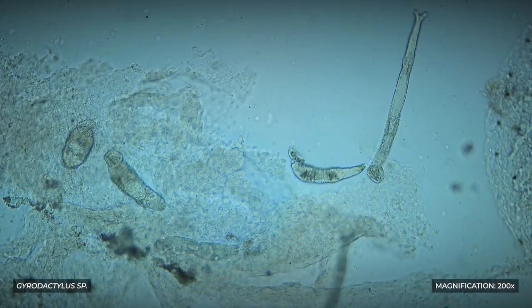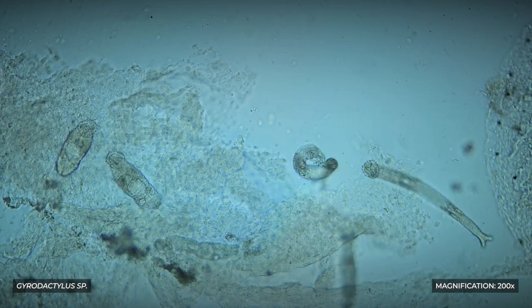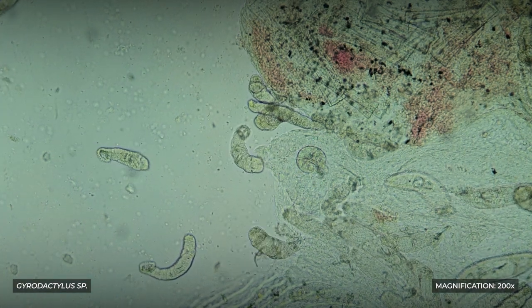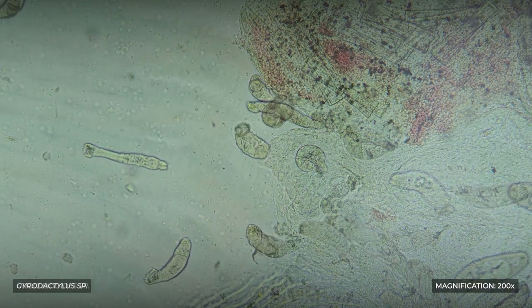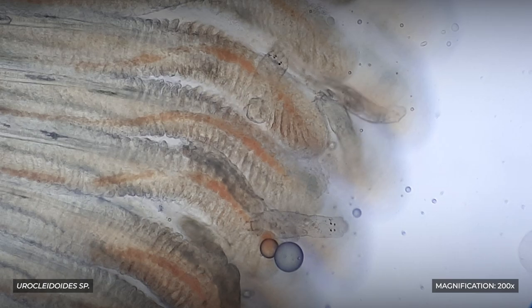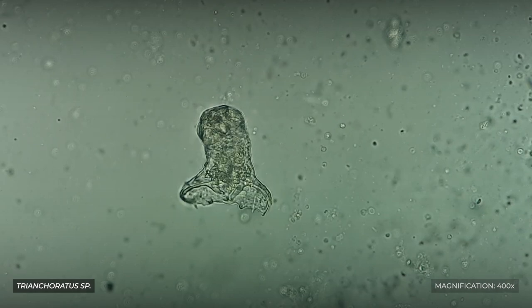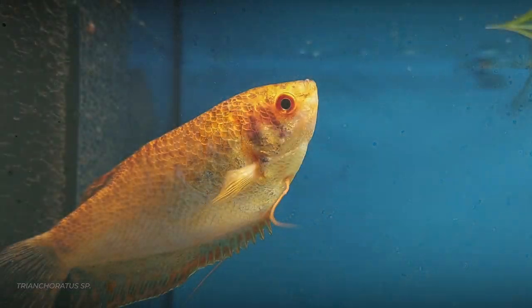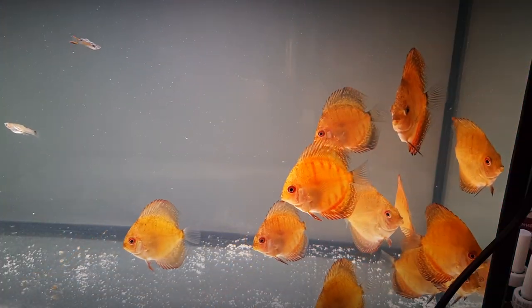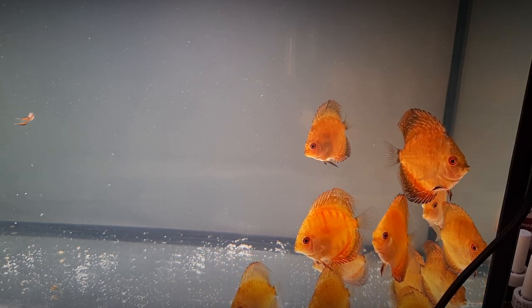The class of flatworms Monogenea, or monogenetic flukes, comprises about 2200 species, all of which are parasites of fish, amphibians, and other aquatic animals. Various representatives of this group can be found in scrapings from the body and gills of fish. One important characteristic of these parasites is their high host specificity, meaning that a monogenetic fluke species only parasitizes one species of fish, or sometimes — but rarely — a few closely related fish species.